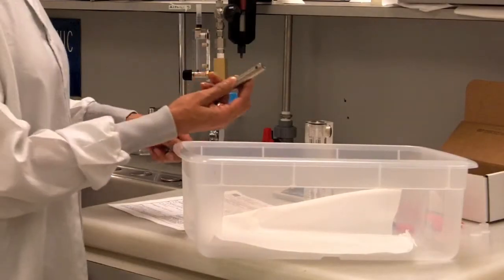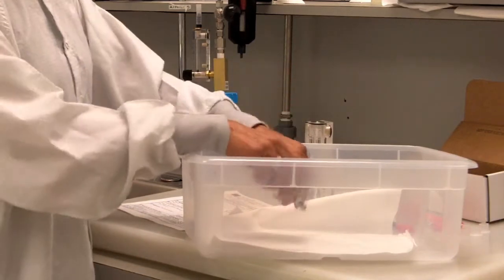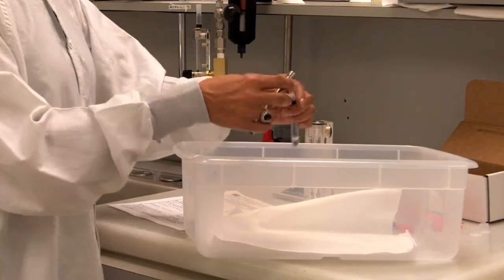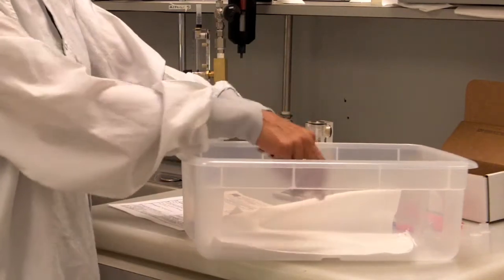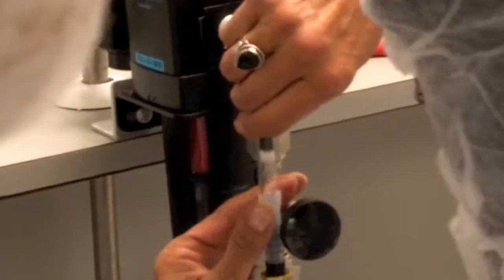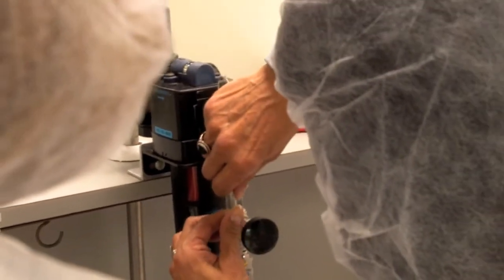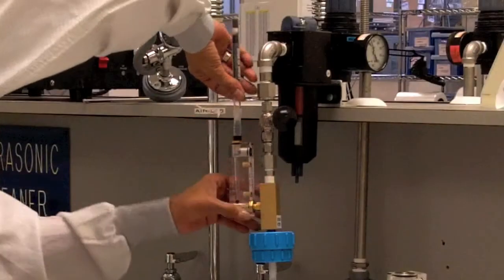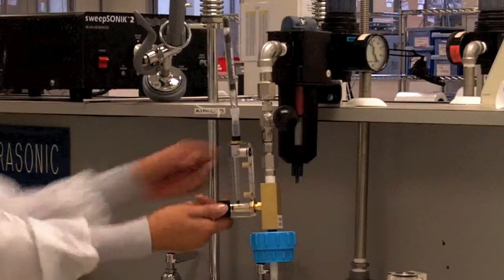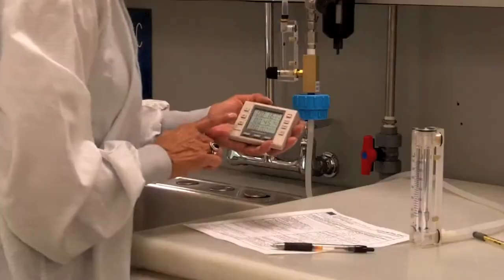Remove both tips from the oil vapor tube by using the larger of the side holes on the tip breaker. Apply sideways pressure until the tip breaks. Always use caution when breaking the glass tips. Insert the oil vapor tube by adjusting the white tubing on top of the flow meter. The arrow on the tube should point away from the flow meter.